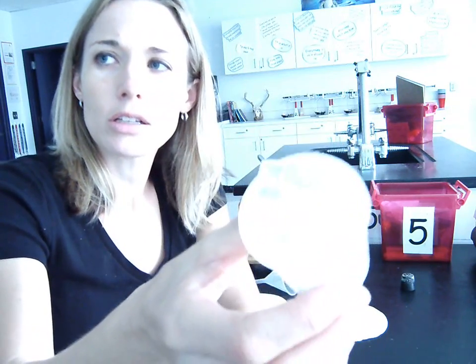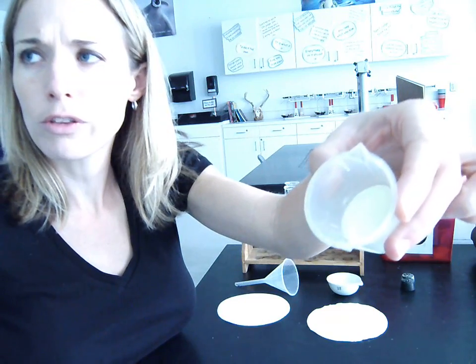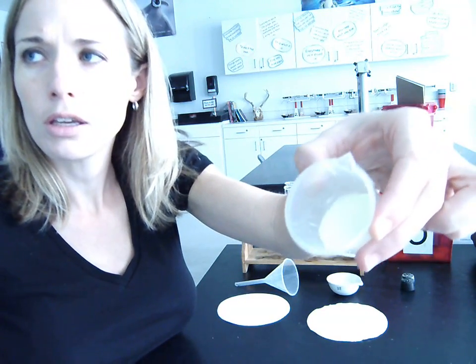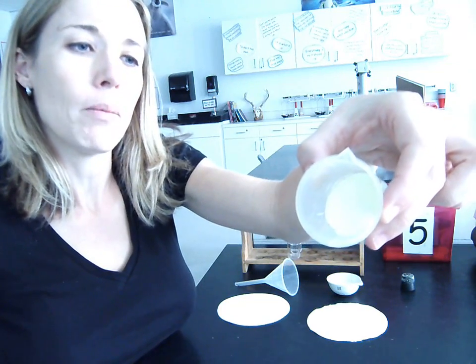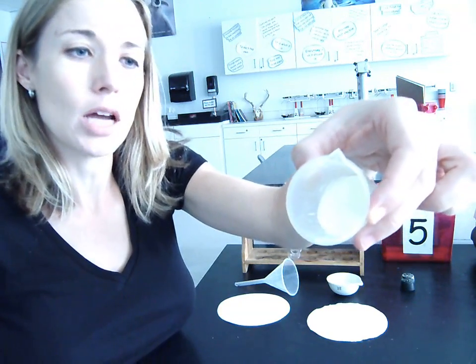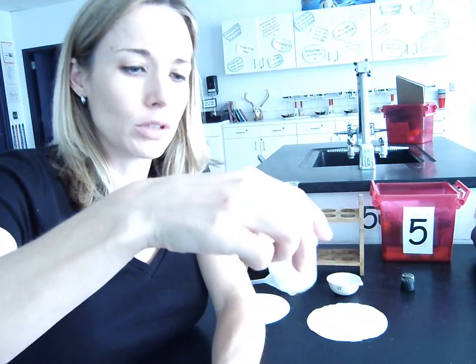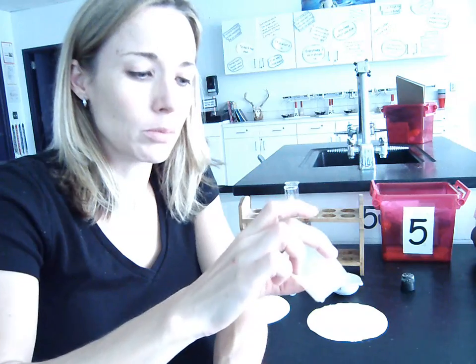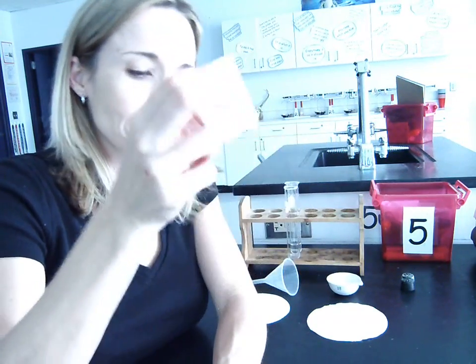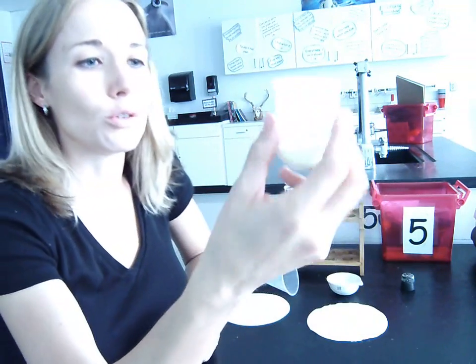So, the glare is awful. I keep trying to find a good place in this room to record this without the glare, but I just can't. I don't know if you can see it very well, but it's a mixture of sulfur and salt. The sulfur, as we've already seen, does not dissolve in water, but the salt will dissolve in water. So the difference between this lab and the reading from 5.3 is that rather than both substances being insoluble, one is soluble, one is not.